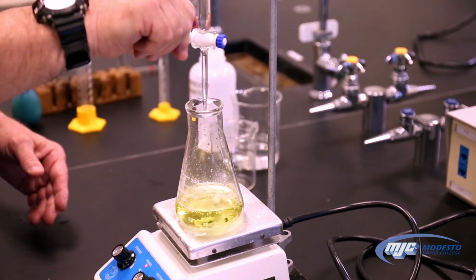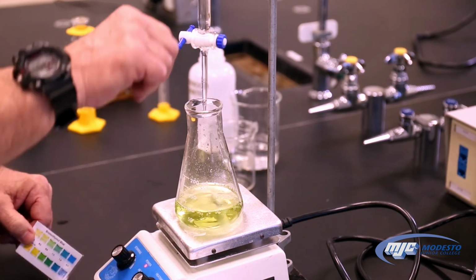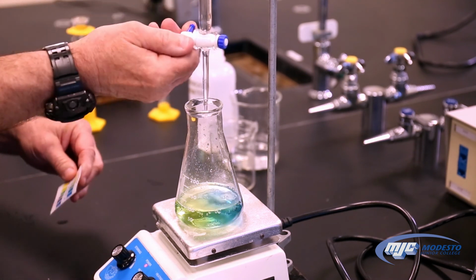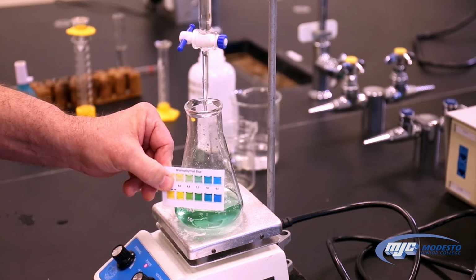I can see a hint of green start to hang around, but we're looking for this and we're not quite there yet. Keep on going. And that time, we got it.